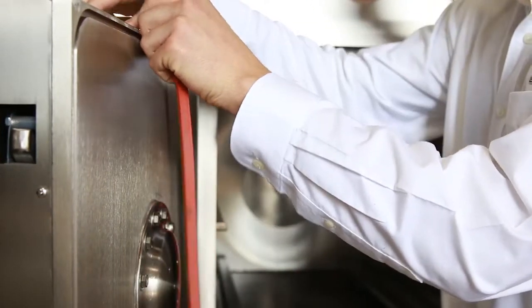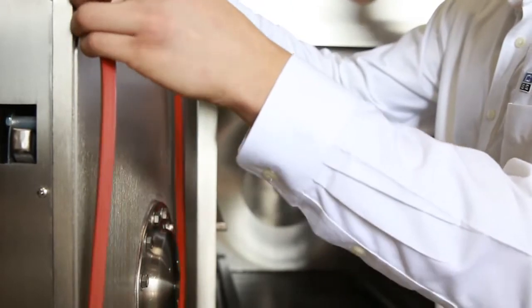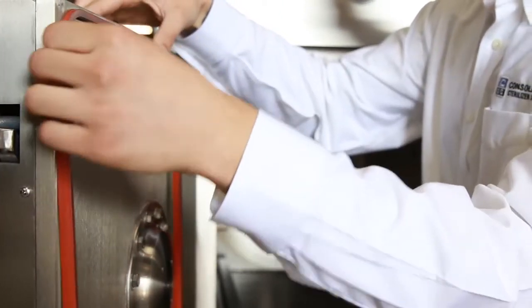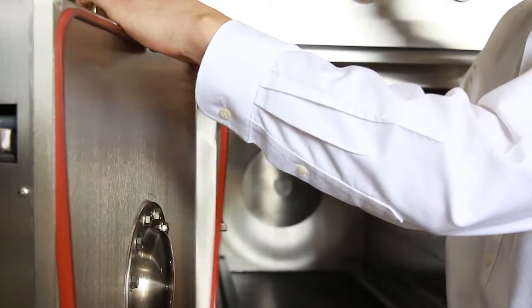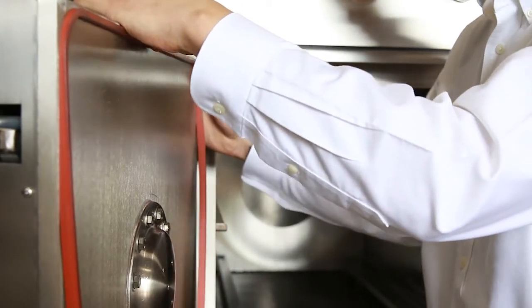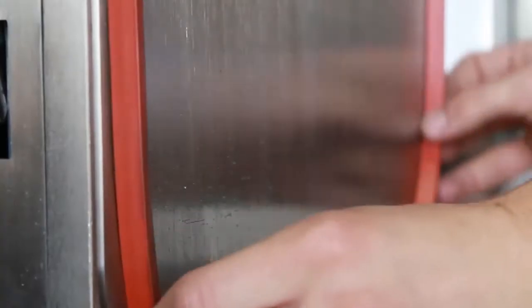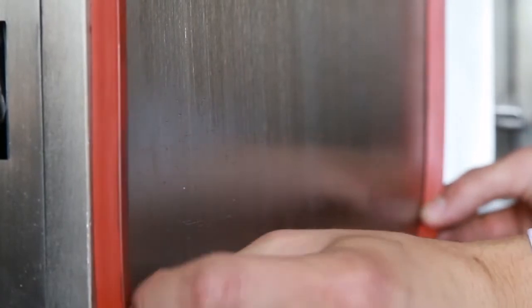Begin with the top corners, pressing in the gasket. Work your way down to the bottom corners, evening out all the material around the door.